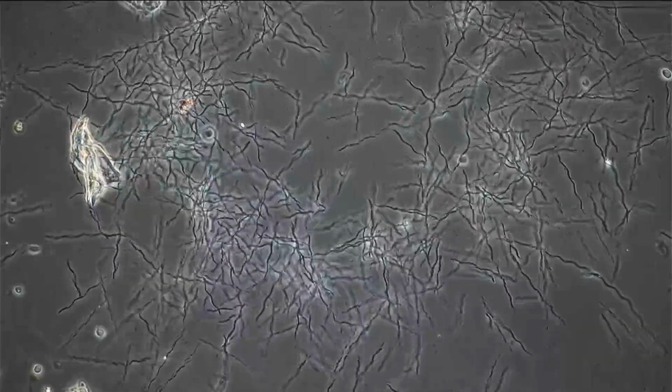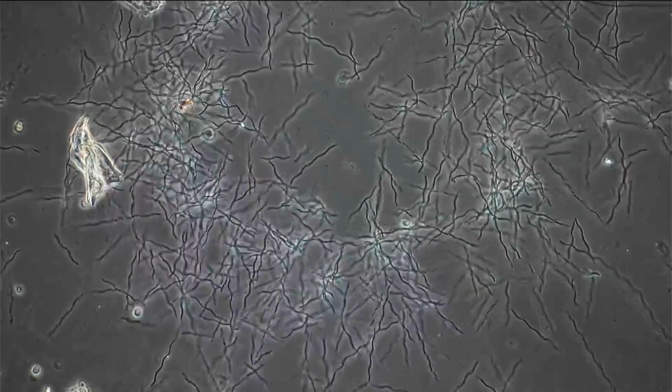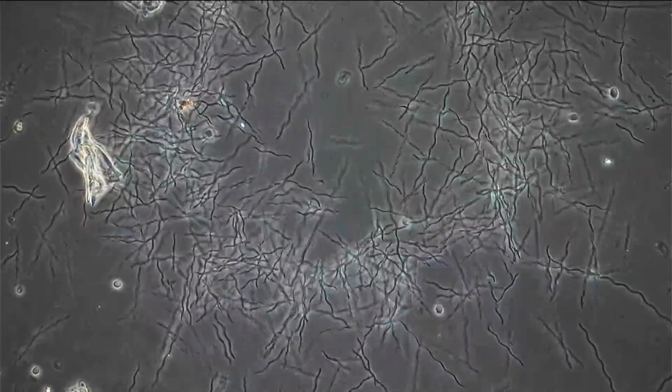Microbehunter here, Oliver here. Yes, I like to put things under the microscope, and today we're going to try something again a little bit more experimental. I would like to test the effect of this hand disinfectant, hand sanitizer on those spiral-shaped bacteria.